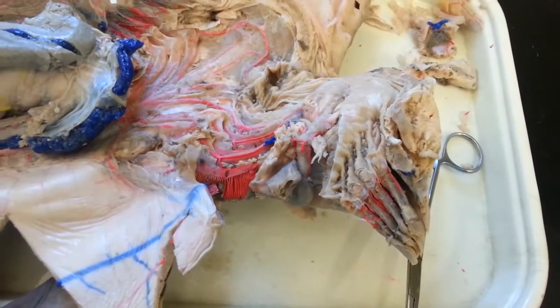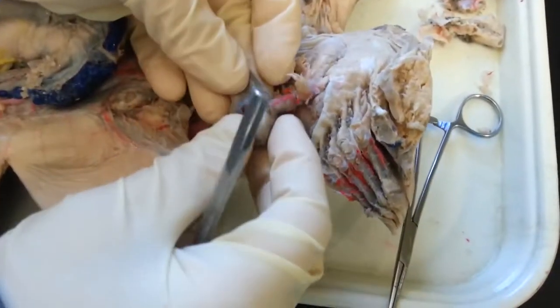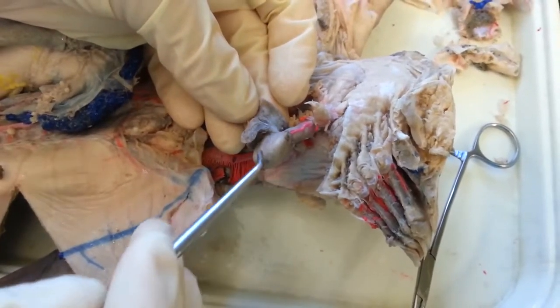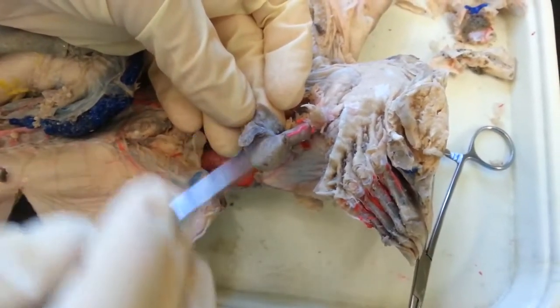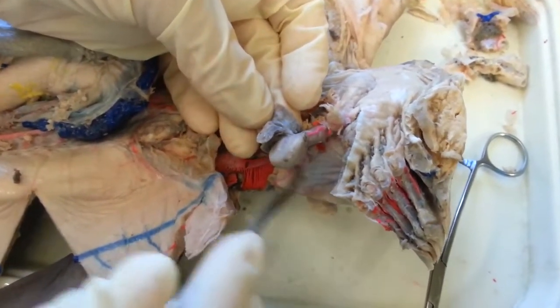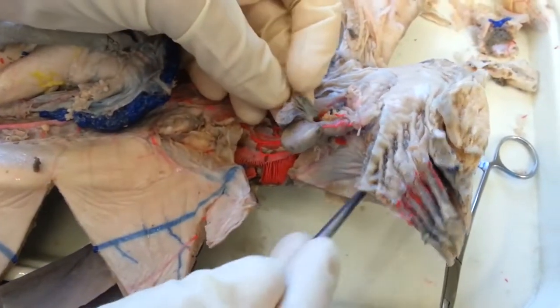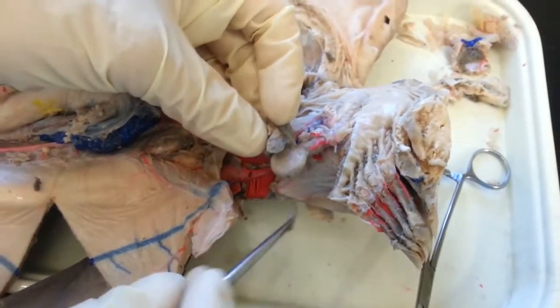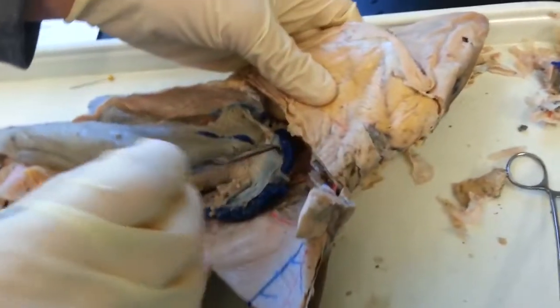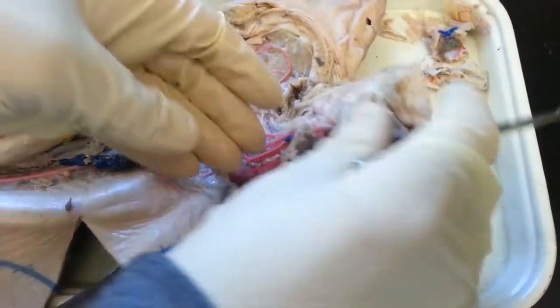Shark circulatory system. Here is the heart, and it has been cut off right here. The serous membrane surrounding the whole heart is the visceral pericardium, and then surrounding the whole chamber where it sits is the parietal pericardium. The heart is separated from the rest of the body cavity through the transverse septum, and we've cut the transverse septum so that we can see everything.